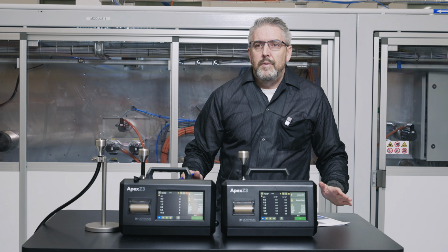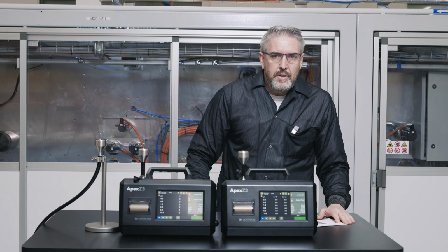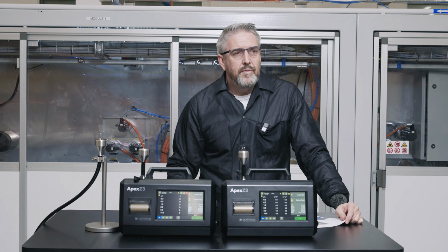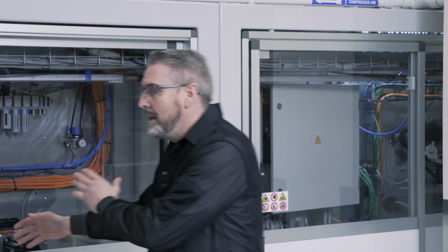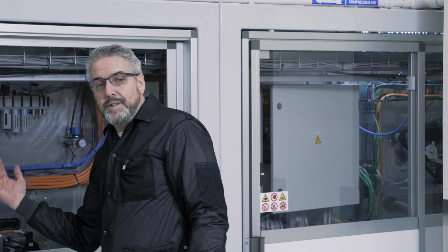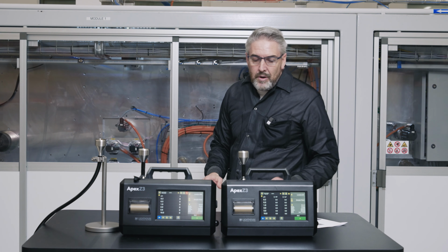Hi folks, we're here today to cover the validation of the sample tubing setup that you would have in your facility for aseptic processing. If you have remote particle counters connected to a filling line, you will have no doubt longer tubing with bends to access where you need to put your remote particle counter to gain access for your sampling probe to sample in the critical zones.